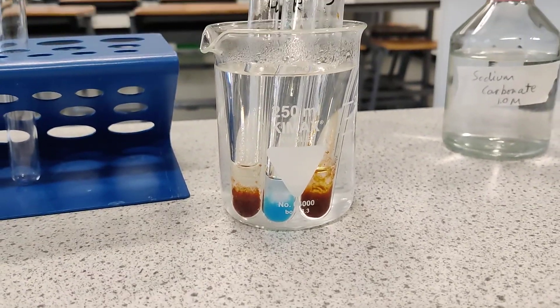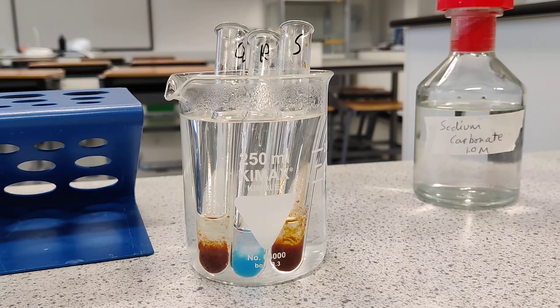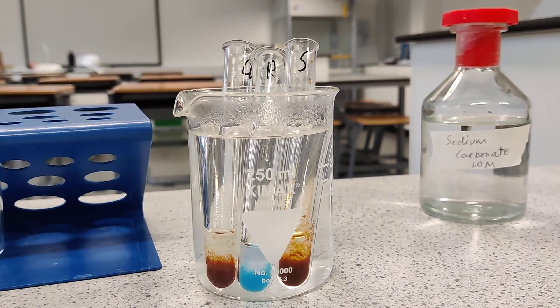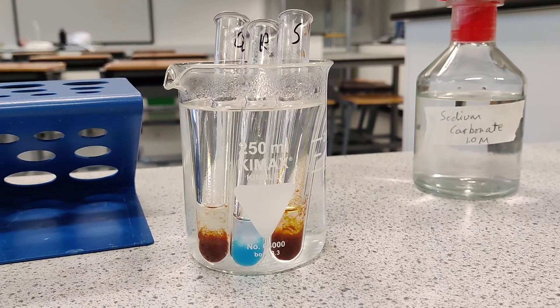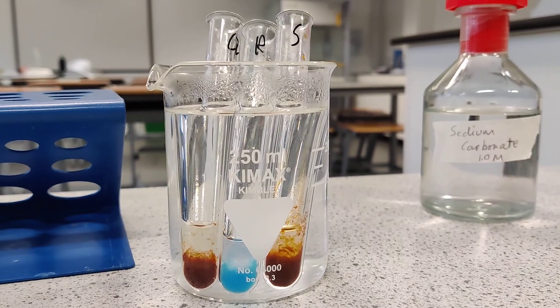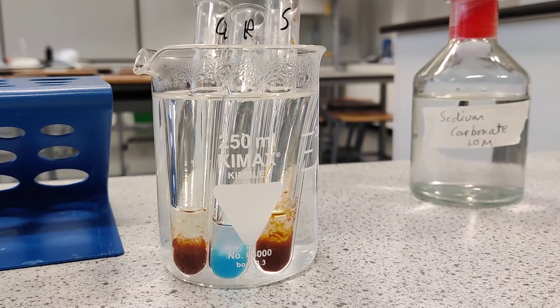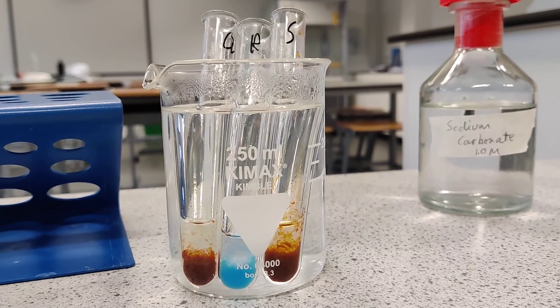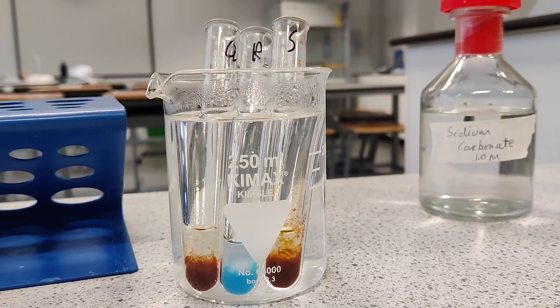No, I don't think there is. So if we look at Q, we've still got this precipitate. We said a brown colour and a brown precipitate, but as we can see, we've actually just got a brown precipitate formed. So the precipitate has settled at the bottom. And then for R, we've still got this nice blue coloured precipitate, which is also settled. And then for S, we've got a brown precipitate formed as well.